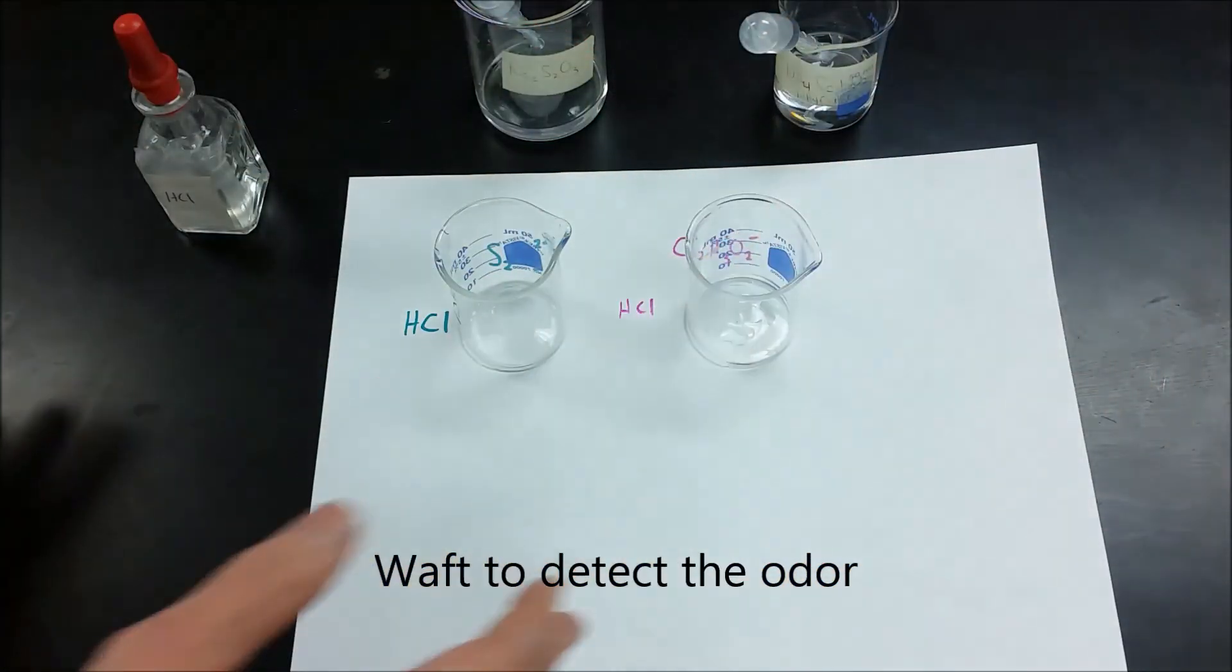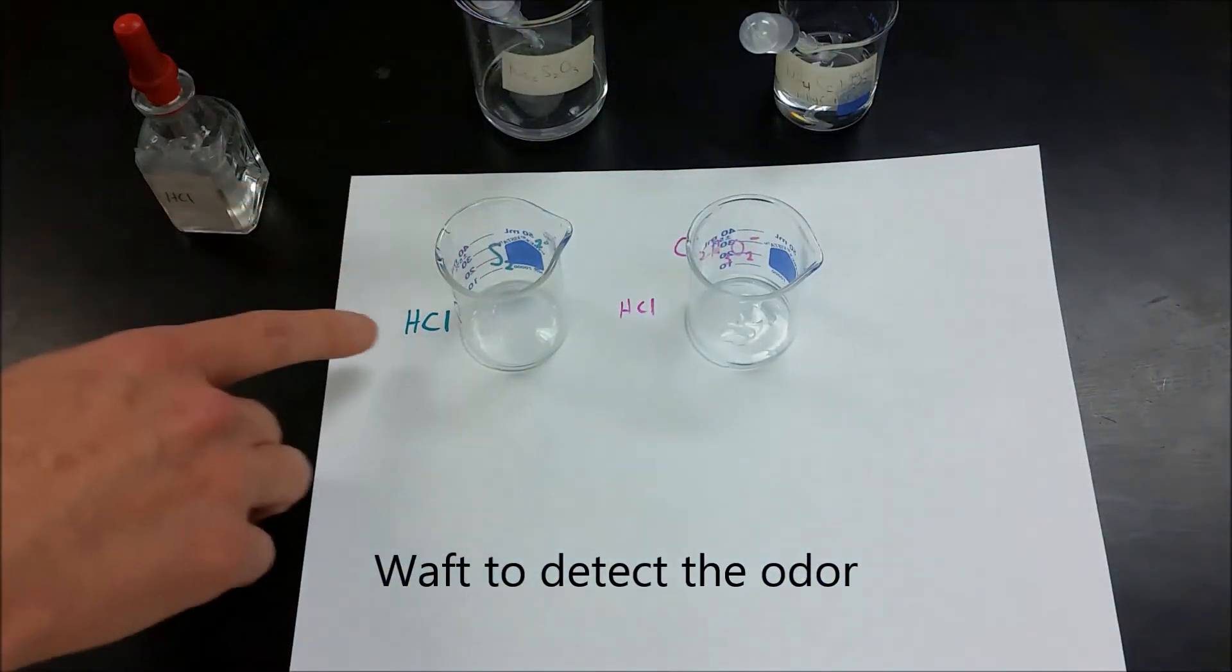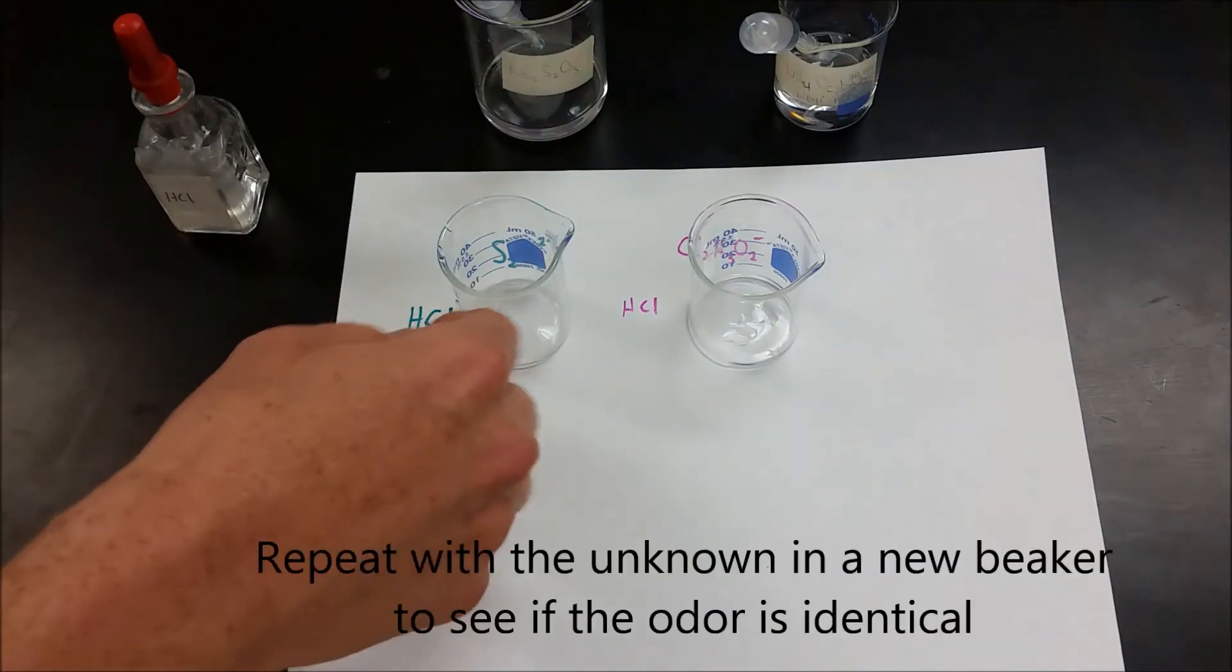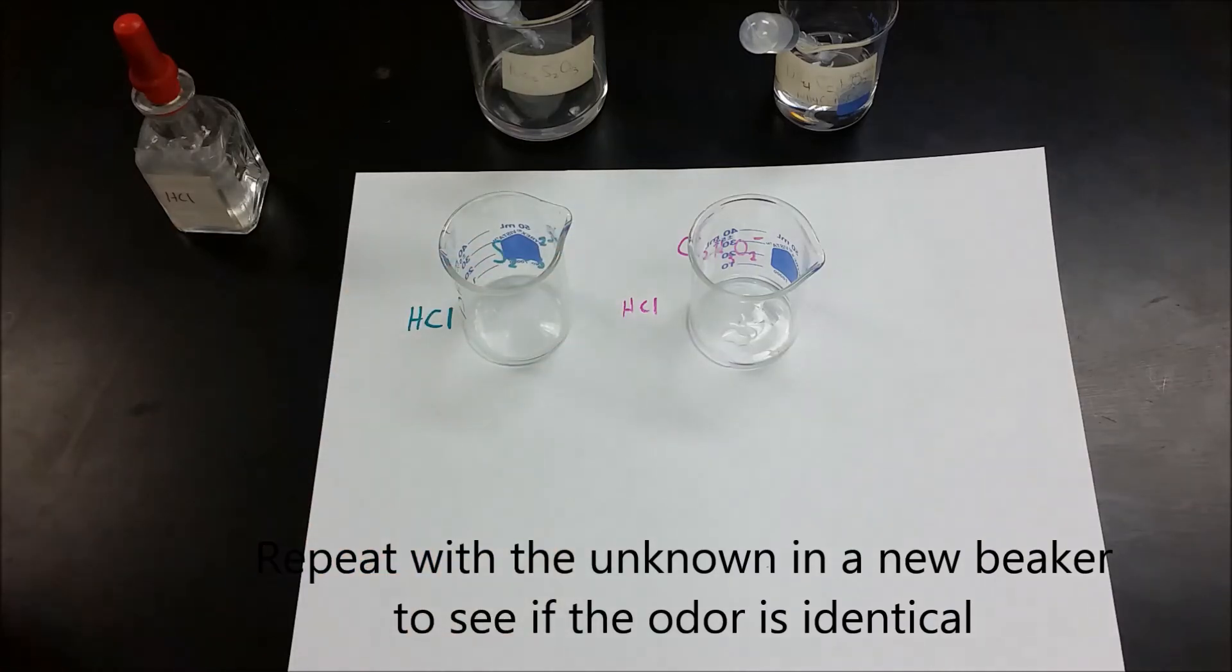Then you're going to repeat the same process with your unknown. Put your unknown mixed with some hydrochloric acid into a beaker and see if the smell is the same. You'll probably want to use a different beaker so you don't smell what was previously there.